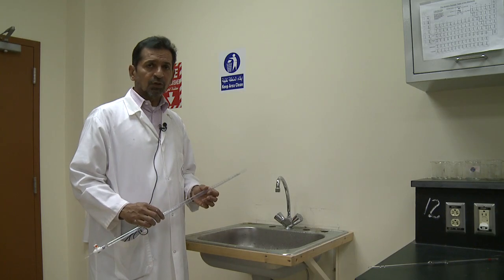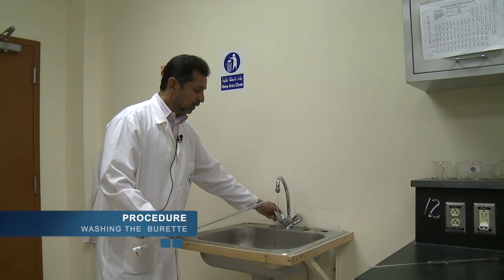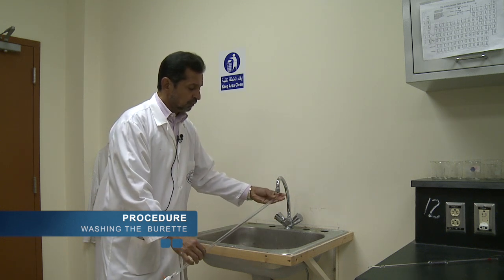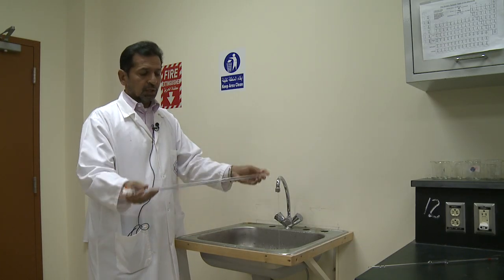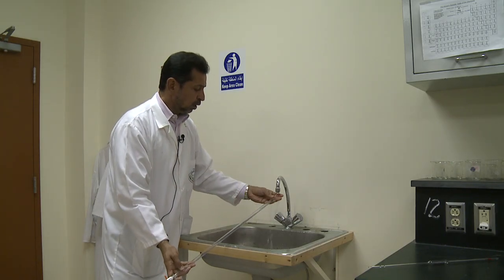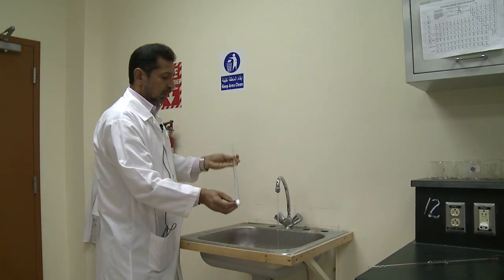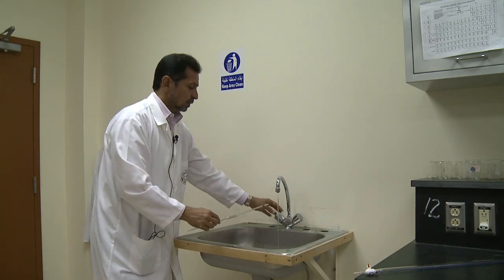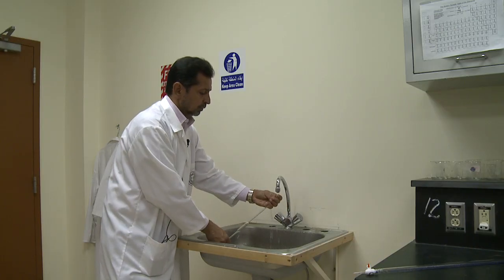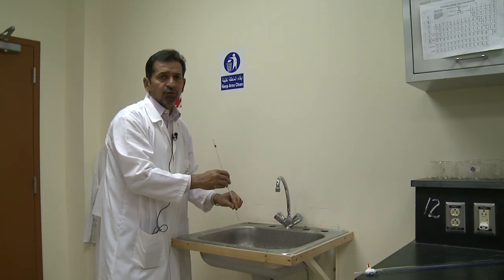To start the experiment, first we have to wash all the glassware, as we need clean glassware. To wash the burette, we pour water in with the knob closed and shake, rotate, and tilt the burette, then throw the water out. We also open the jet of the burette to pass water through and clean the jet. For the pipette, wash it by pouring some water inside and outside. All glassware should be thoroughly washed before starting the experiment.